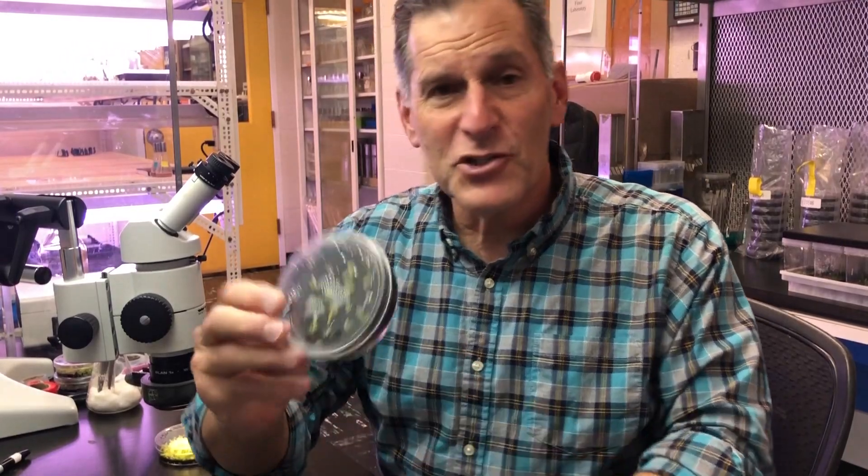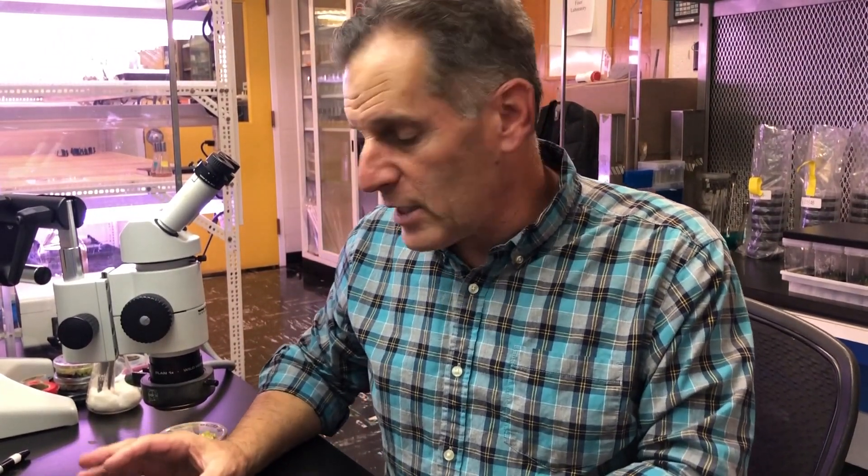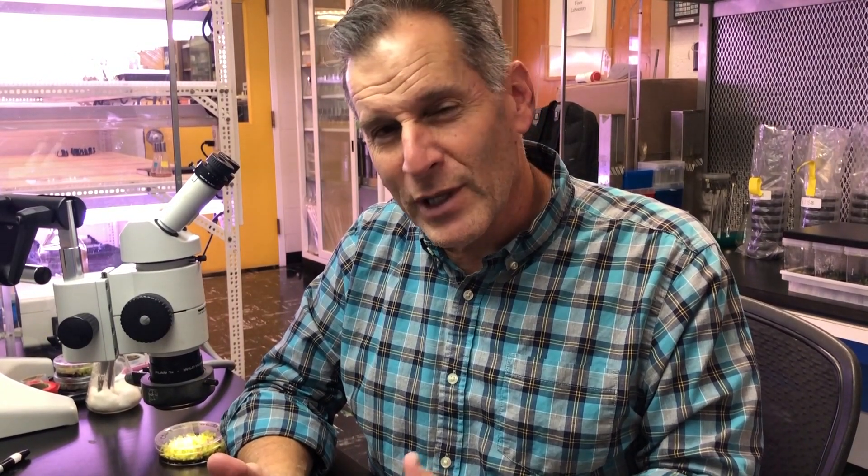What I generated is this dish right here — I made a four-by-four grid of these germinating seedlings. I'm actually testing four different media for how the medium components are going to affect the seedling development. I do use a microscope in order to see what I'm doing. You can really see the embryos and the germinating seeds really, really nicely with this good quality microscope. What you look for is single embryos — single seedlings with a root associated with them.